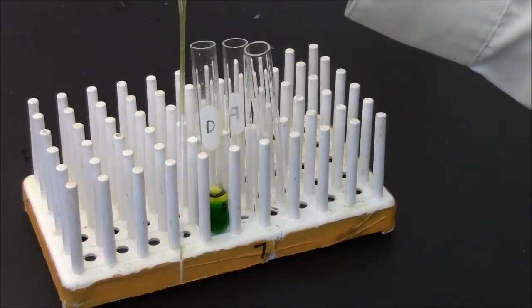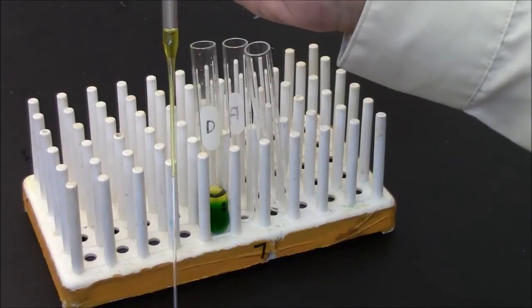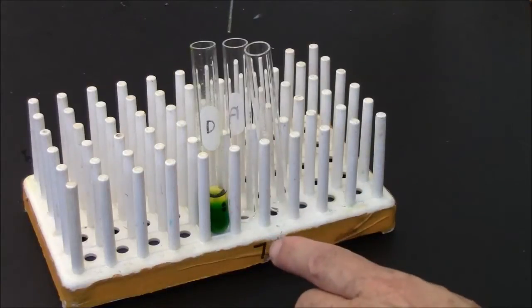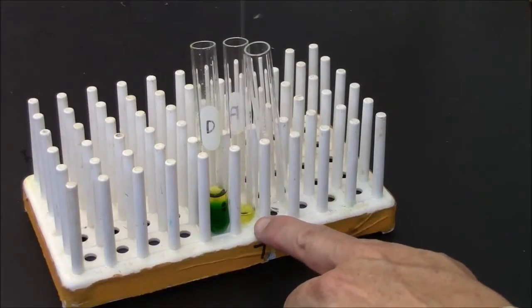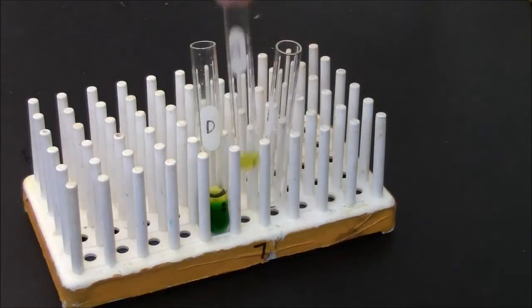There's some of the top layer, and I haven't gotten all of it, but I don't need to because I just want to analyze what's in there, what's its concentration, and this should be an adequate volume for me to do that.